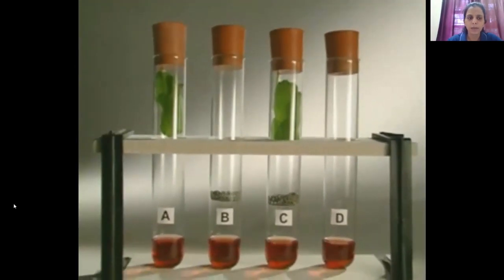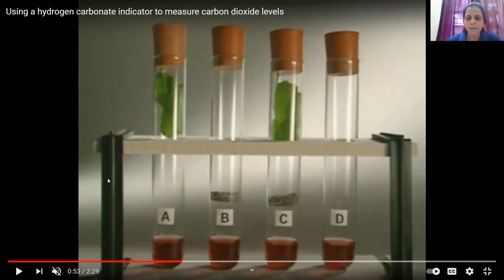Okay. So remember, I hope you have understood. In test tube A, only a fresh leaf has been added. Only a fresh leaf has been placed. In test tube B, there's no leaf, only 2 wood lice. That means only the animal is placed here. In test tube C, animal is placed as well as leaf. And in test tube D nothing has been placed, so this test tube D is acting as a control.